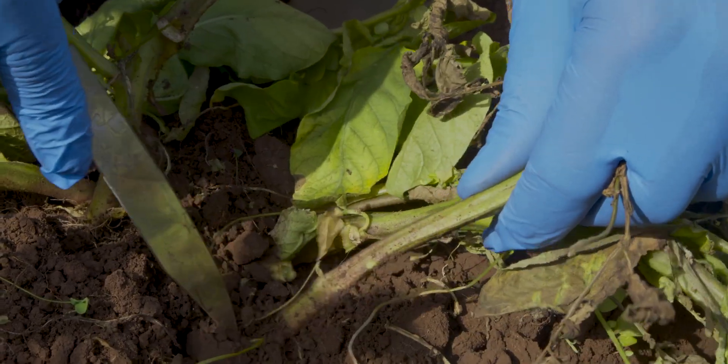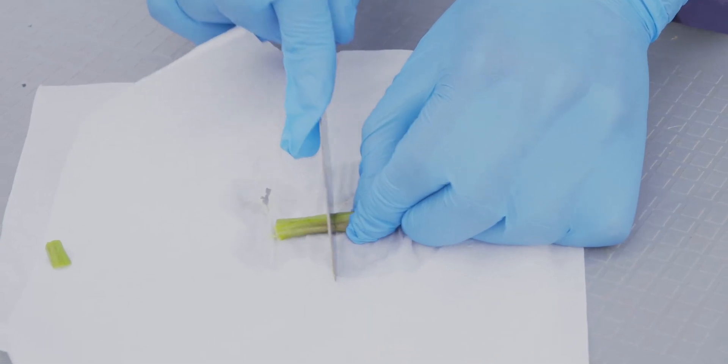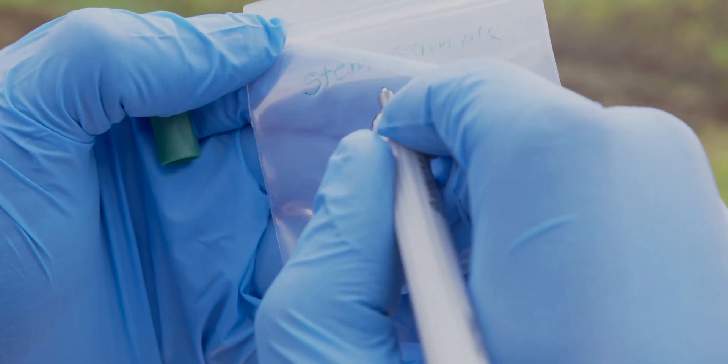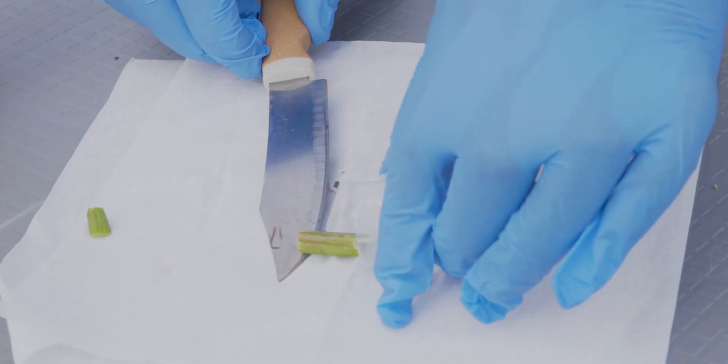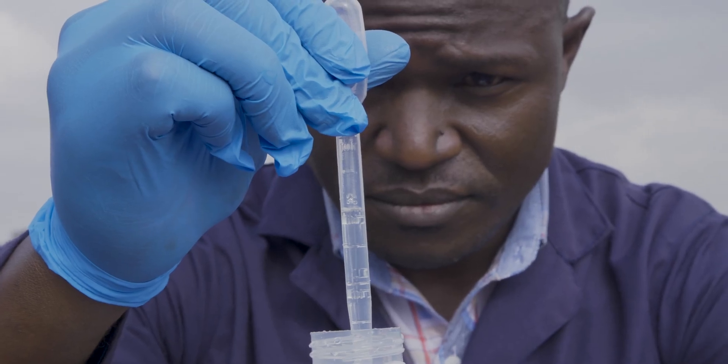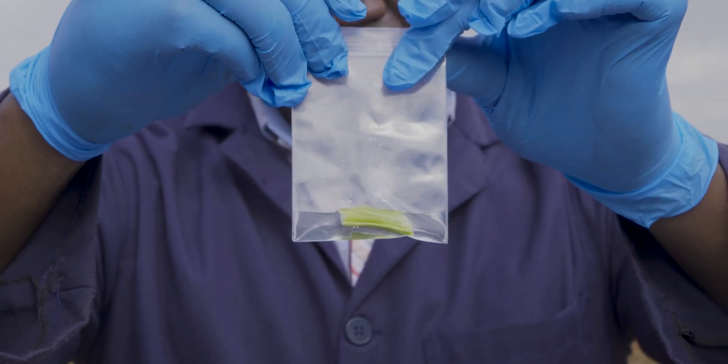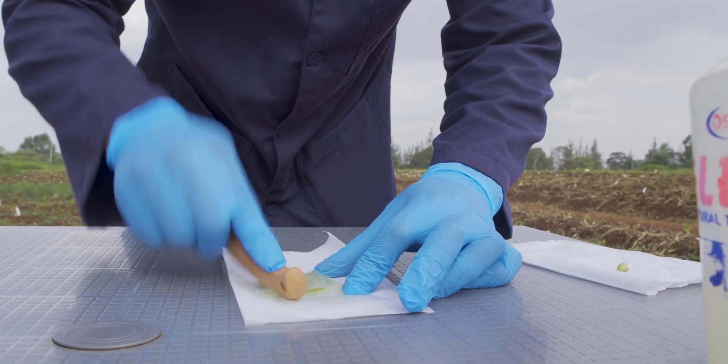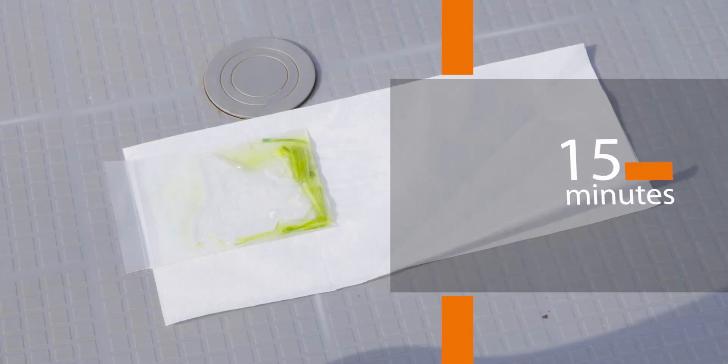Wash surface of your stem and wipe with 70% ethanol. Cut a stem fragment of approximately 2 cm. For potato stem samples, the alkaline PEG reagent should be at least 10 times the volume of the stem fragment. With that in mind, dispense 2 ml of alkaline PEG reagent into a labeled plastic sample maceration bag with your stem sample. Add stem sample to maceration bag and manually crush it. Let sample stand for 15 minutes before using it as a template for lamp reaction.